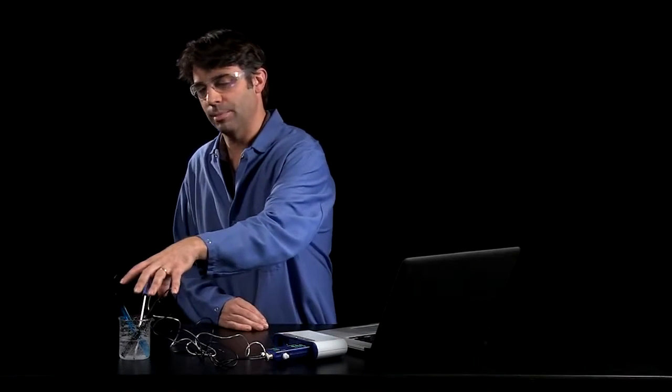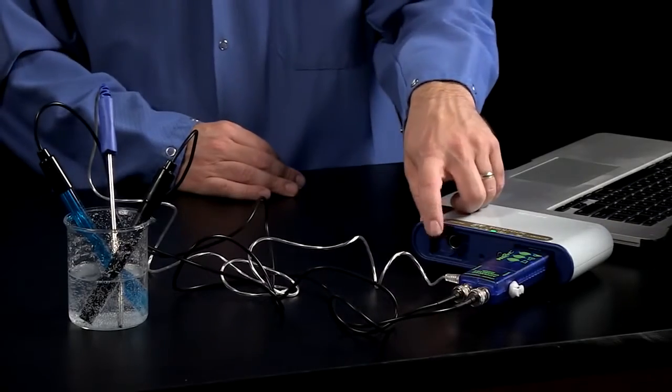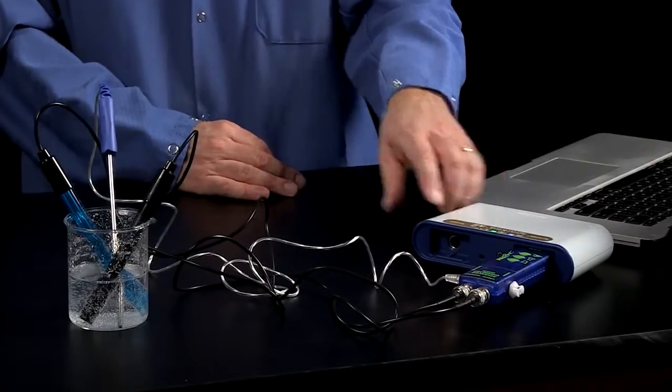Now in chemistry, we often want to look at a reaction like this where we understand the amount of reactants added. And typically we do that with a titration. So I'm going to open up some data from a titration that I performed. This was a titration of hydrochloric acid with sodium hydroxide, a very simple acid-base titration, strong acid, strong base. I used the Advanced Chemistry Sensor, so I can make simultaneous measurements, and I used a drop counter in the other port of the SparkLink Air. The advantage of the SparkLink Air is it allowed me to use both of those sensors at the same time.